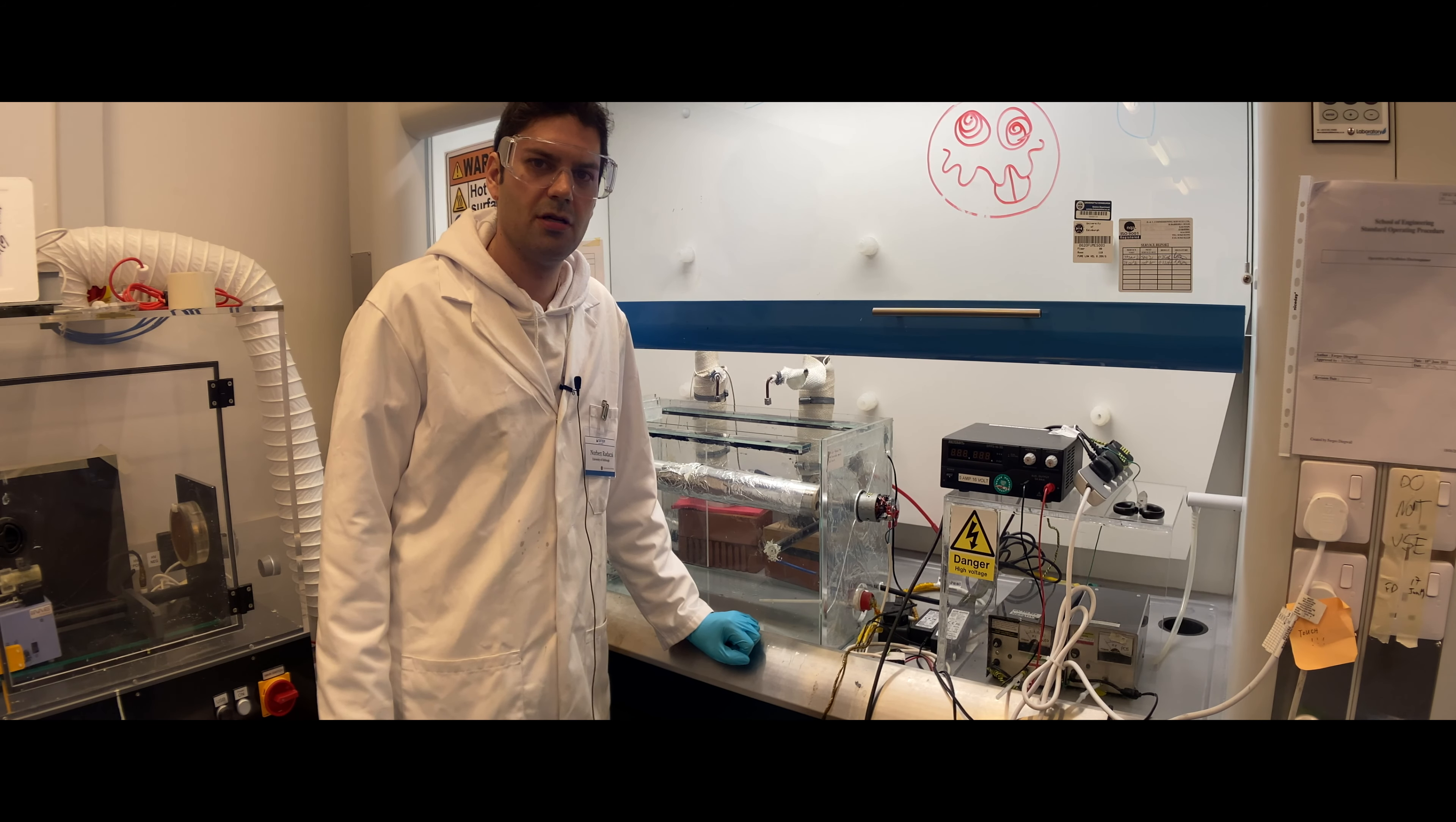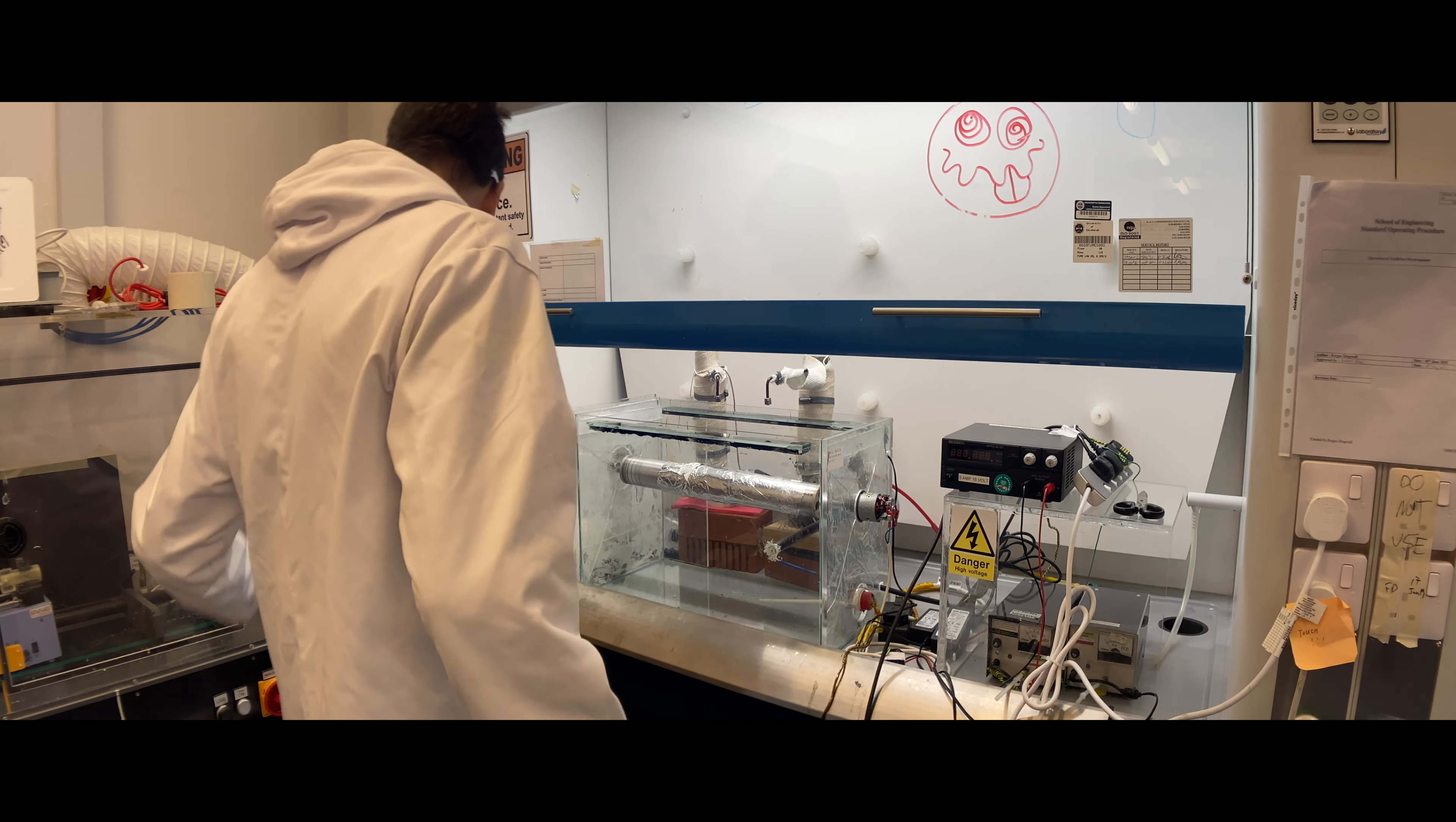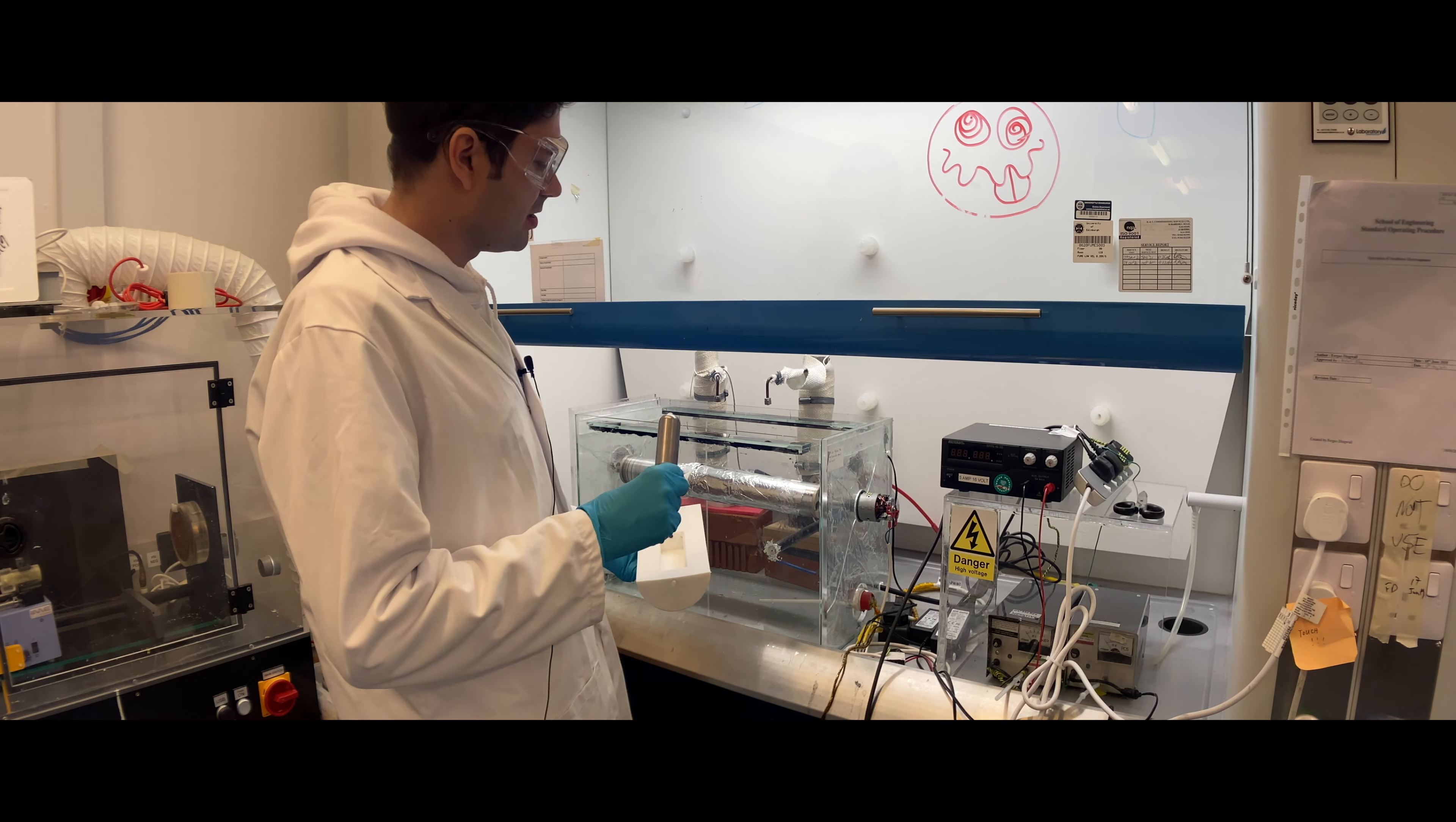Hello, my name is Dr. Norbert Radacci, and I'm going to explain how to use needleless electrospinning. This setup is a home-built electrospinning system I built with my team, and it's good for scaling up systems because instead of using a needle or nozzle, it uses a rotating cylinder, coil, or sphere.